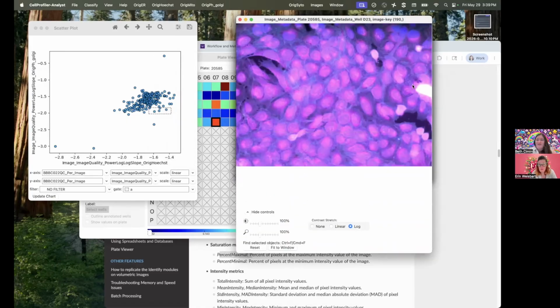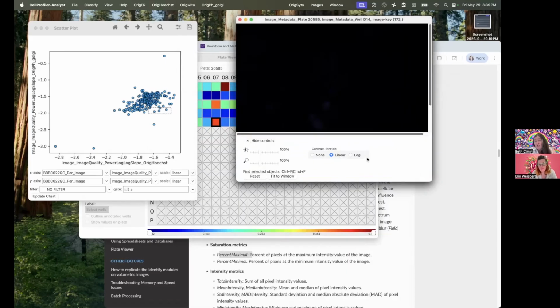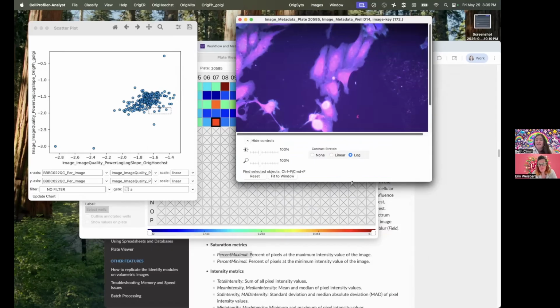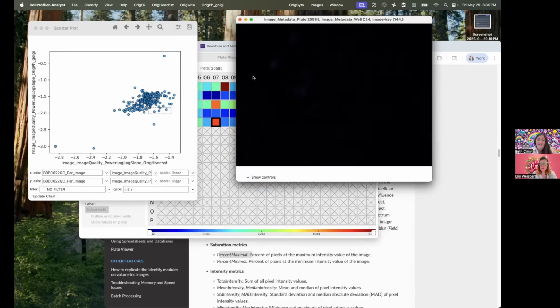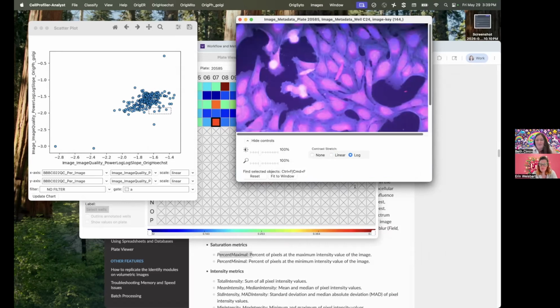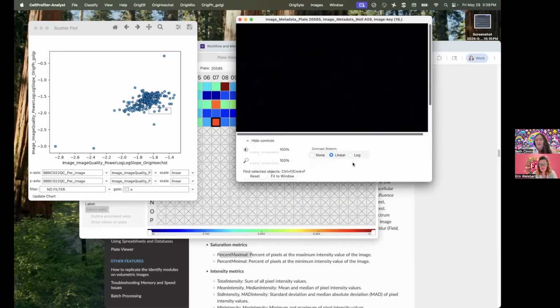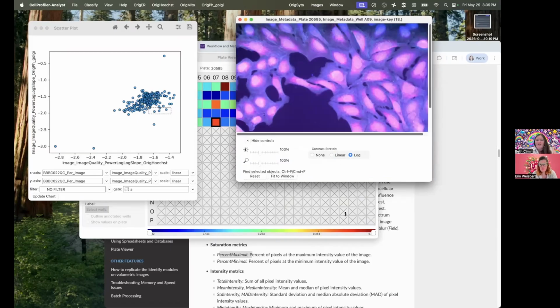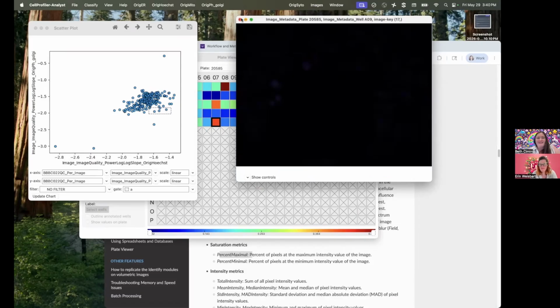Or they might have a different metric just because of a little piece of debris that's off to the edge. That wouldn't, for me, say I'm totally uninterested in this image. I would just say maybe I want to mask that part of the image out. And it's hard, right? Because we always want to try to figure out how we can keep most of our data in. Nobody takes data just so that they can throw it away.